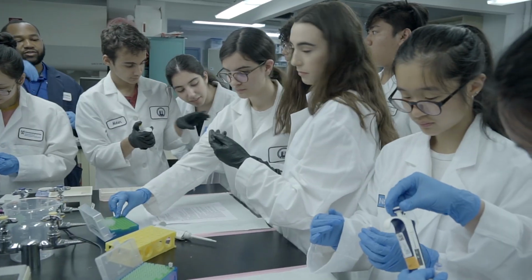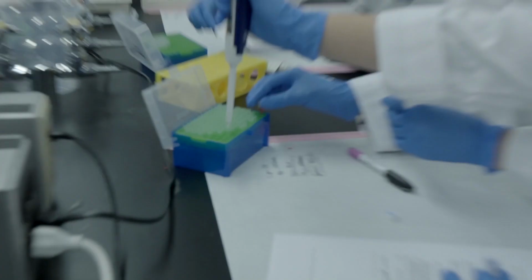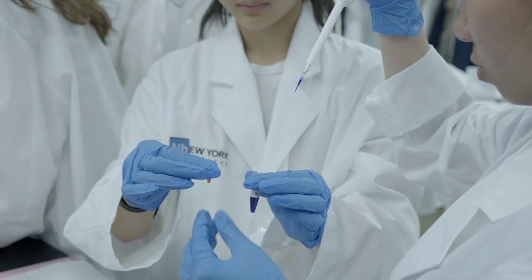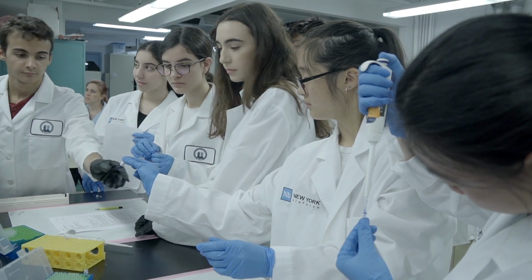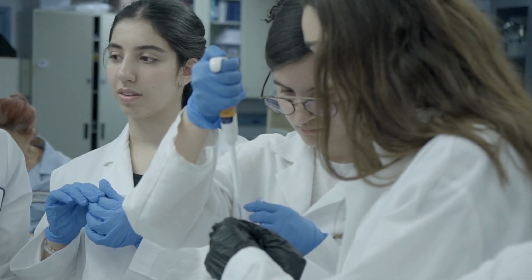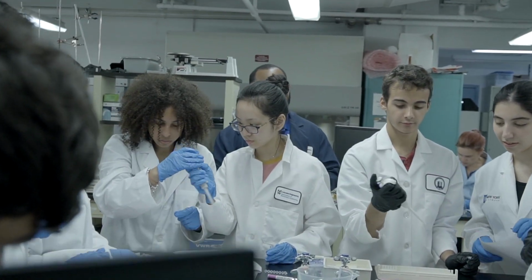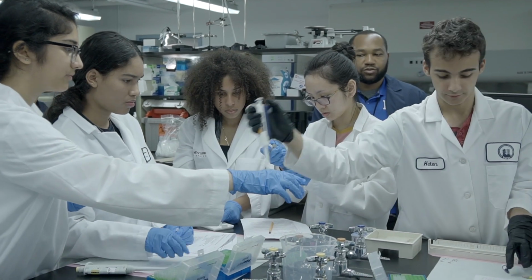Also, while you're waiting, feel free to take turns coming around. You can touch the gel. It's solidified at this point. See what it feels like. You can touch it again once I take it out. But it hardens in about 20 minutes. Once you've added your blue dye to both tubes, just set them down once everybody's done before we actually load the gel.